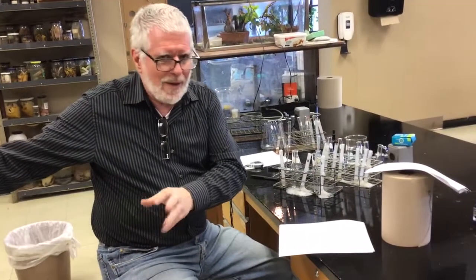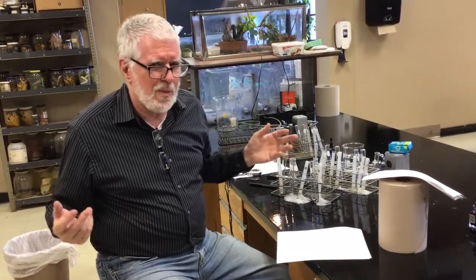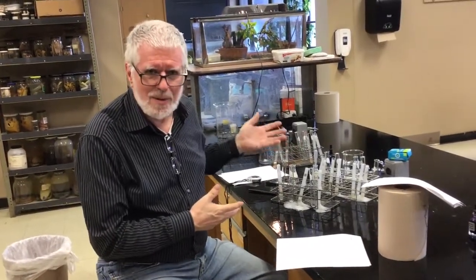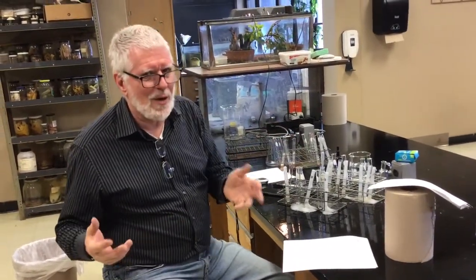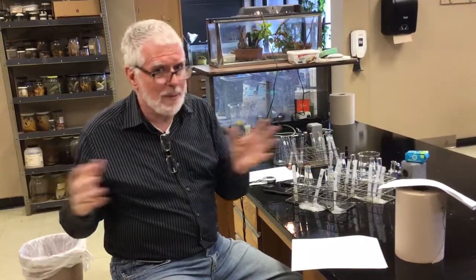If everyone produces different solutions, because everybody is mixing their water and liver and grinding it differently, so they're all gonna be different, then why are these tests reliable? You have to figure out what it is you're actually looking at in terms of your results: different people in the room with different starting catalase preparations are still getting comparable results. The point there is, what does comparable mean in this case?